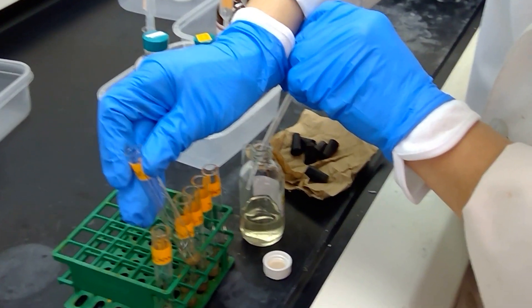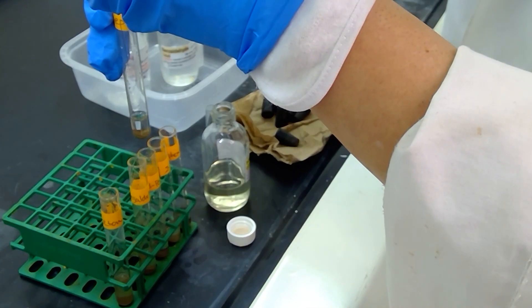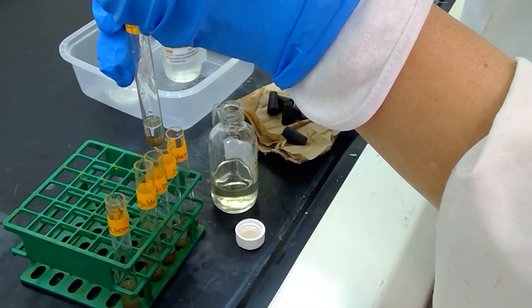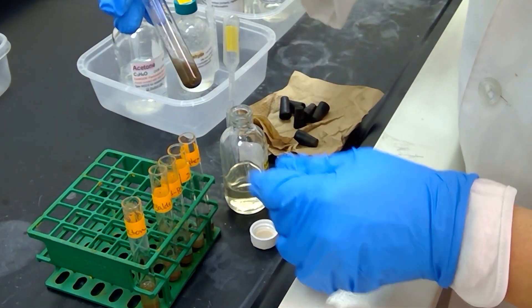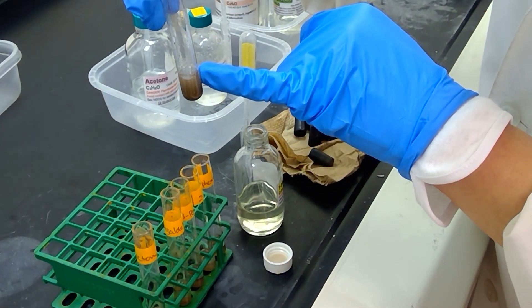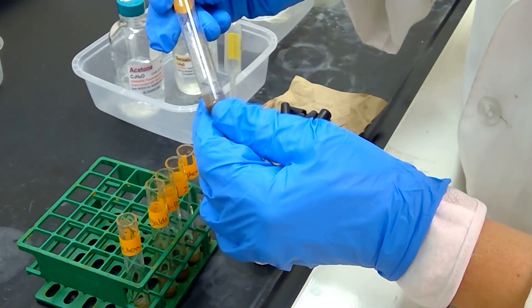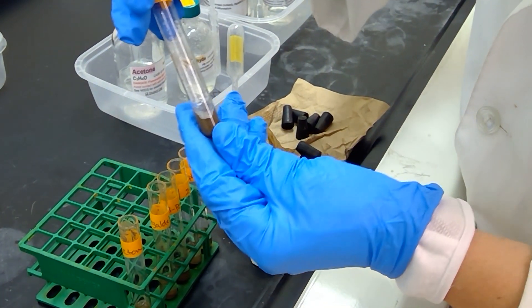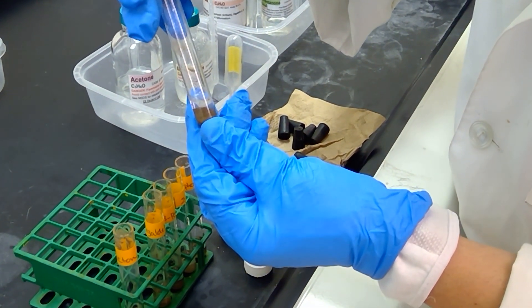Let's take a look next at heptanal. I'm going to add a few drops and start shaking the solution. If you notice here, we're starting to see a little bit of something forming at the top of the solution. I will go ahead and tilt it sideways and do our best to take a look at the sides of the silver mirror.